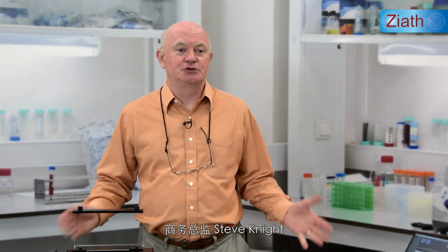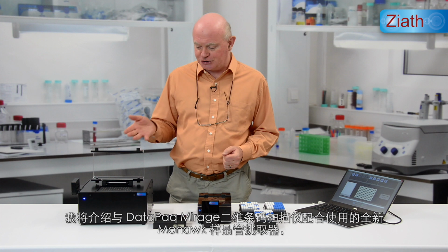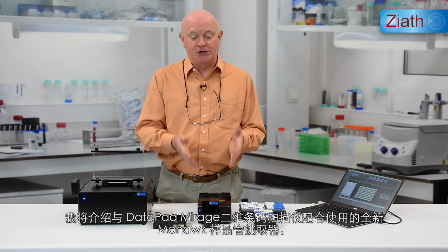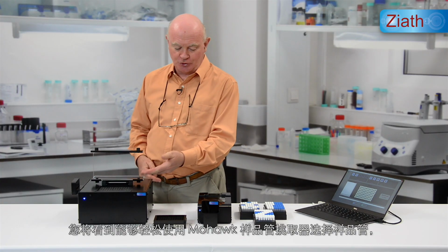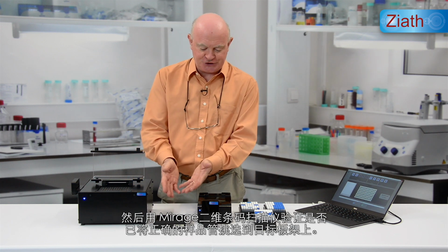I'm Steve Knight, Commercial Director, and in this short video I'm going to explain how the new Mohawk Tube Selector, working in conjunction with the DataPaq Mirage 2D rack scanner, can simplify the process of selecting tubes from racks which have come from your library. You'll see how easy it is to select individual tubes using the Mohawk and then to verify that the correct tubes have been picked to the destination rack using the Mirage 2D scanner.